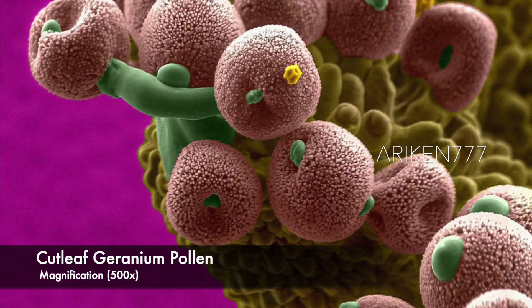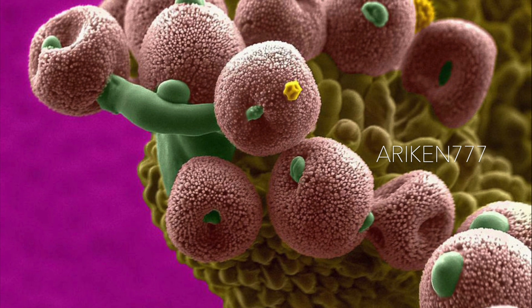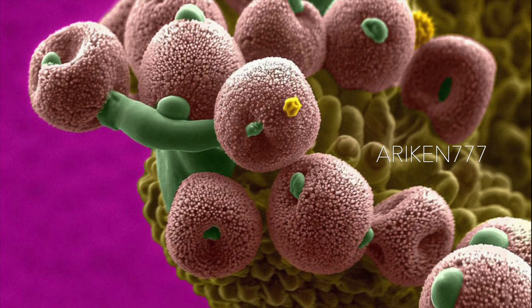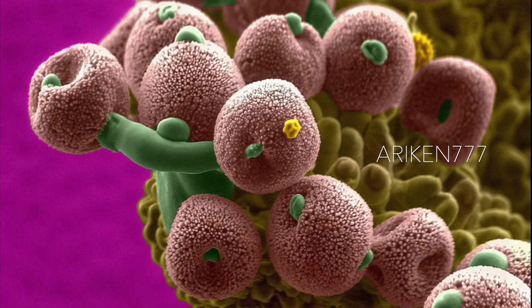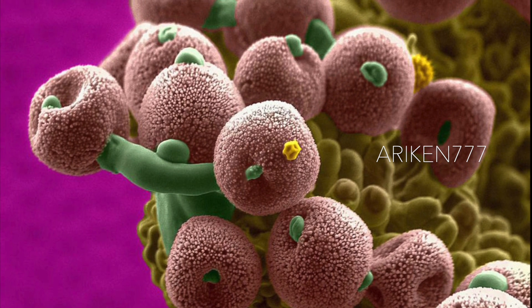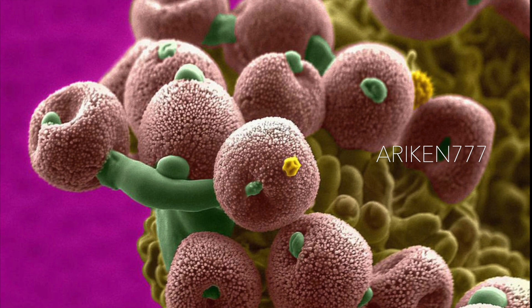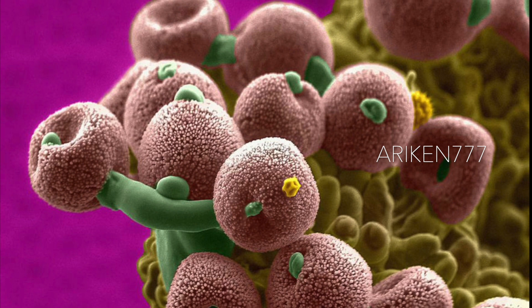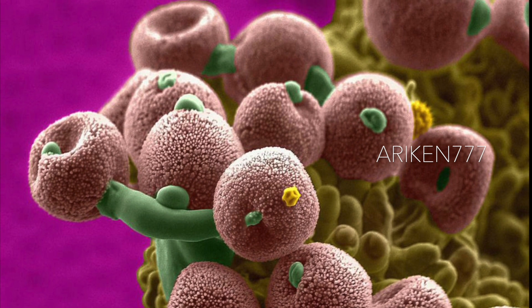These are the pollen grains of Geranium dissectum, also known as cutleaf geranium. They are native to Europe but can also be found on other continents as introduced species. It commonly grows in fields, orchards, vineyards, woodlands, and along roadsides. In the United States, it is considered an invasive species in some states.